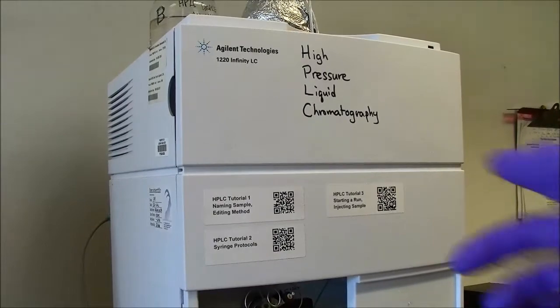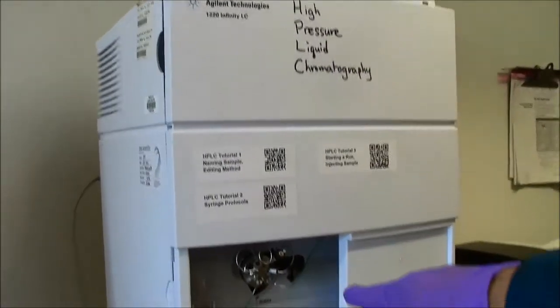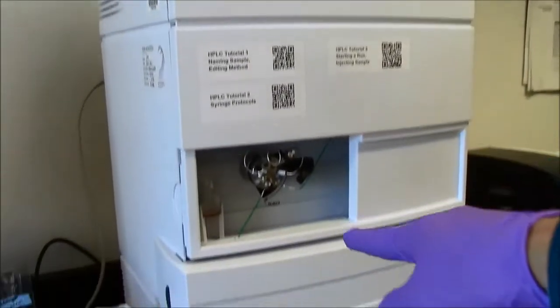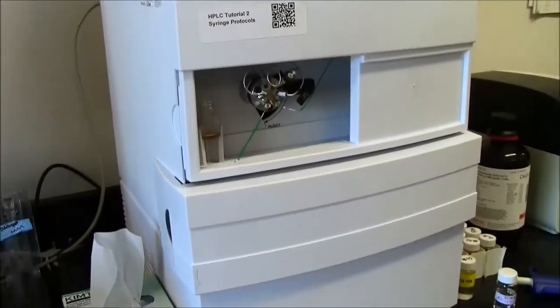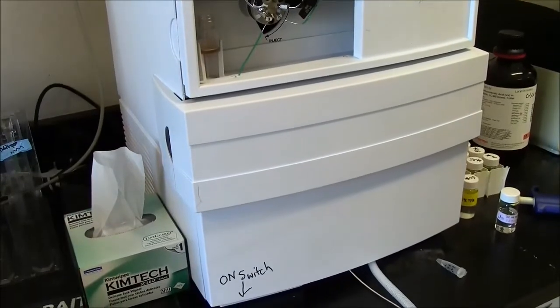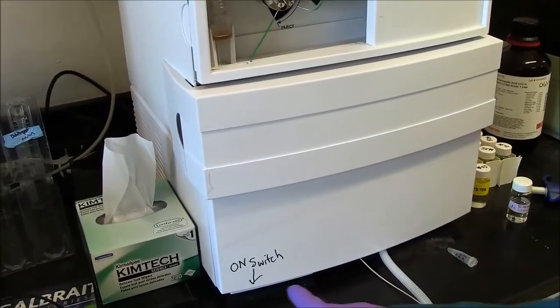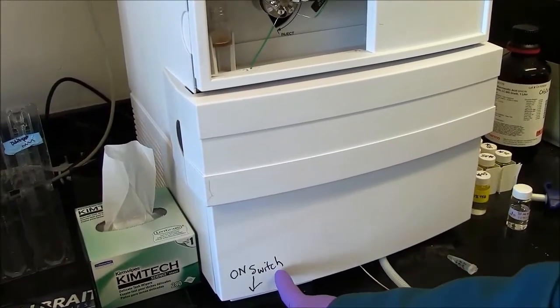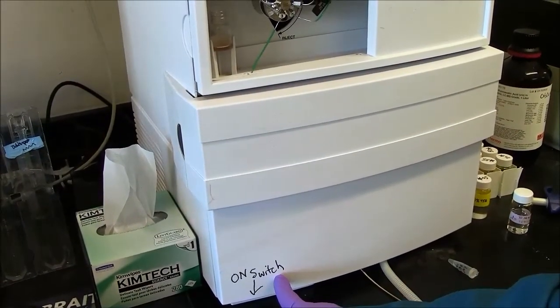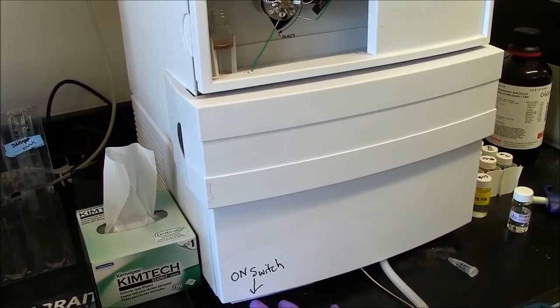Normally, the guts are covered up, so all you can see is the injection port. That's all you really need to worry about. The on switch, if you need to turn it on when you're the first person in, is under here.